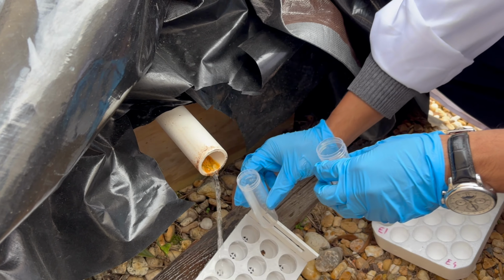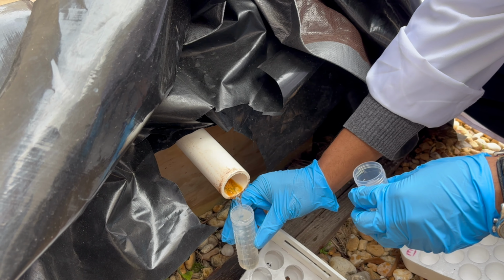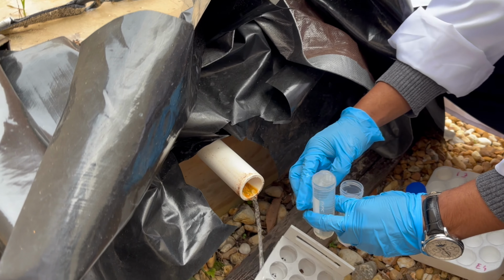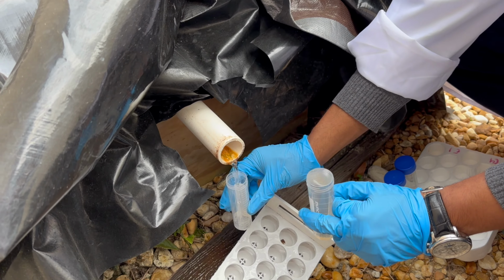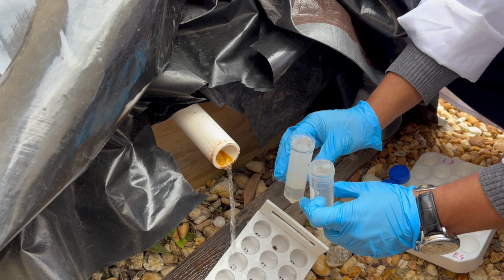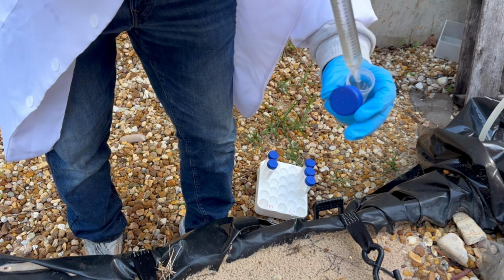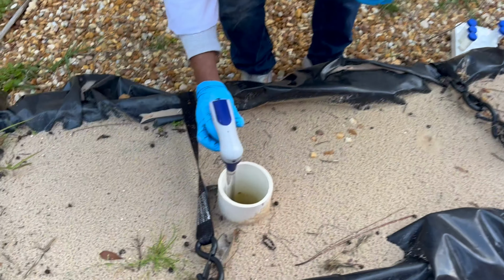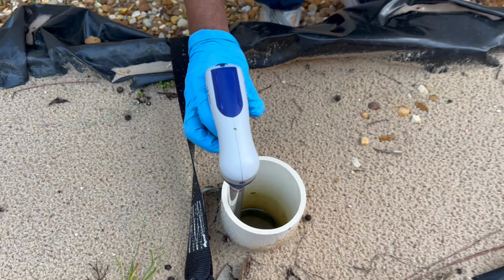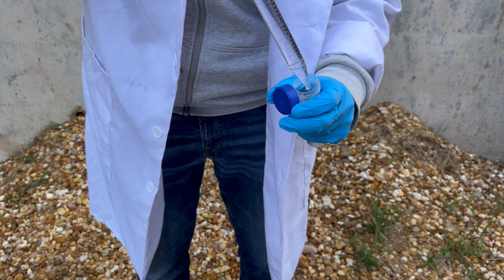Now we will start taking samples from the effluent portal. After the solution is flowing from the influent portal, it will take some time for the solution to reach all the way to the effluent portal, but eventually when it comes, we will take triplicate samples. Now repeat the process for port 1 and port 2 by taking samples from port 1 and port 2, and make sure to take triplicate samples from both ports.